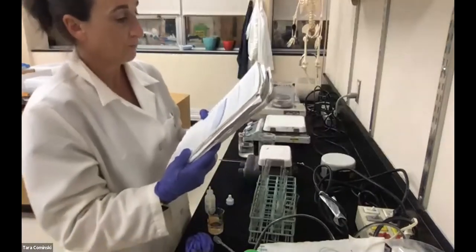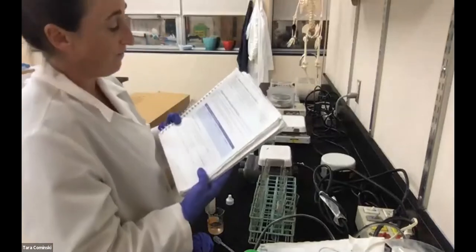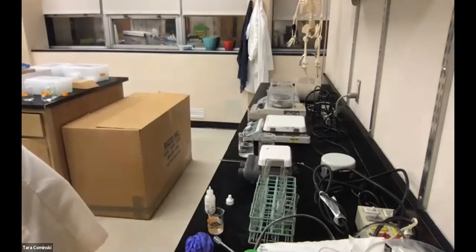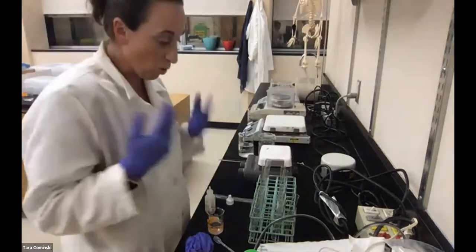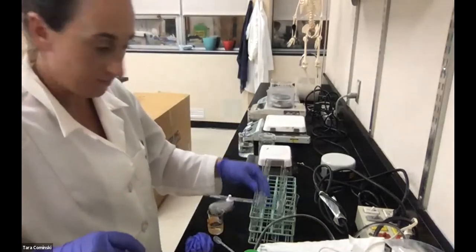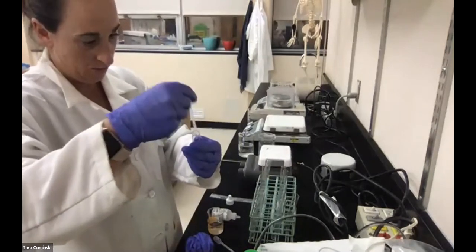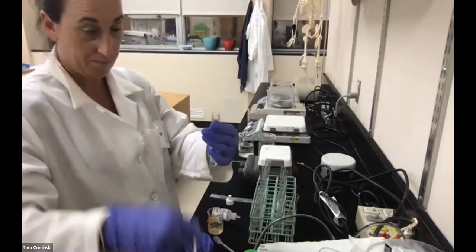In this case, it tells us to add the peroxide first, and then add 1 mil of water for one, and for the others we're adding 1 mil of catalase and then more catalase. So we're going to start with the peroxide. 1, 2, 3, 4.